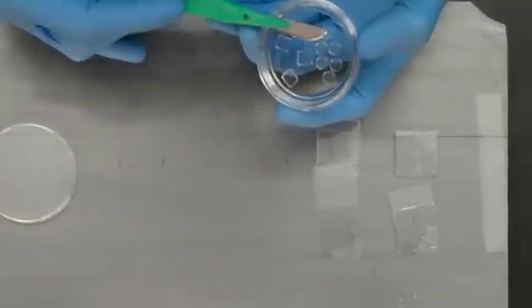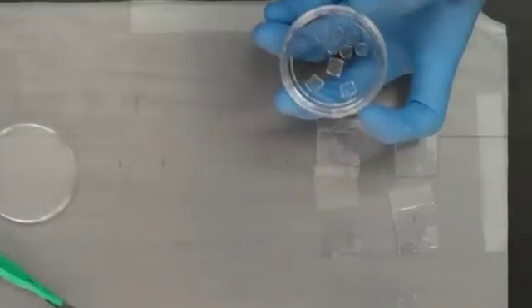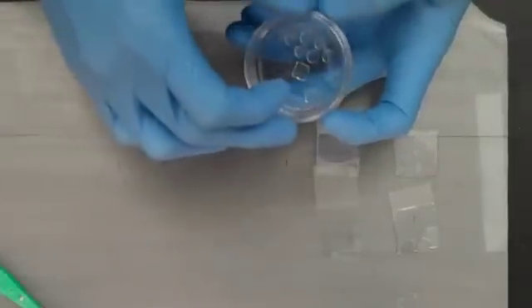Before proceeding with time-lapse microscopy, ensure your imaging surface is properly sealed to prevent pad evaporation.